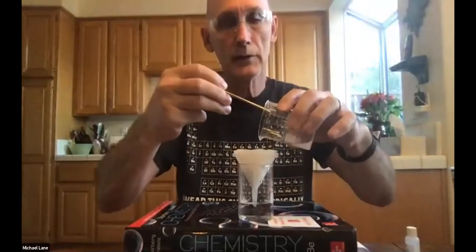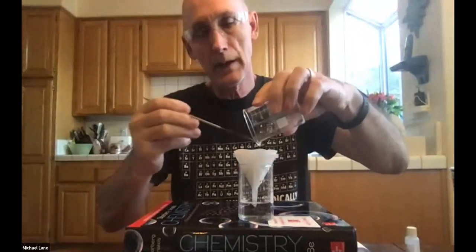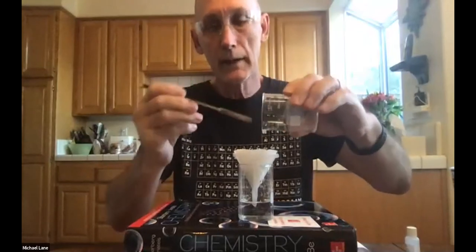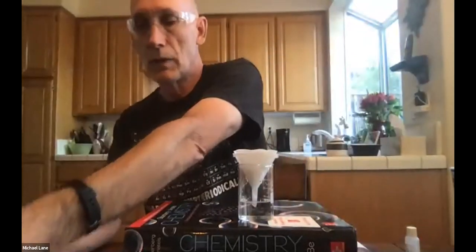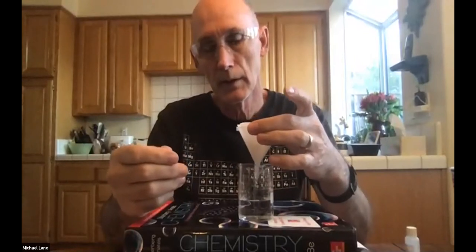In a research lab or an industrial lab, there would be different kinds of glassware that makes this transfer far more quantitative. Quantitative is just a way of saying it makes it far more complete. But under these circumstances, we really get enough to filter through. You can't see the drops coming through because the bottom of the funnel is now immersed, but trust me, it is moving through. Again, I'll lift this up and of course you can see the drips continuing. So that's going to continue.